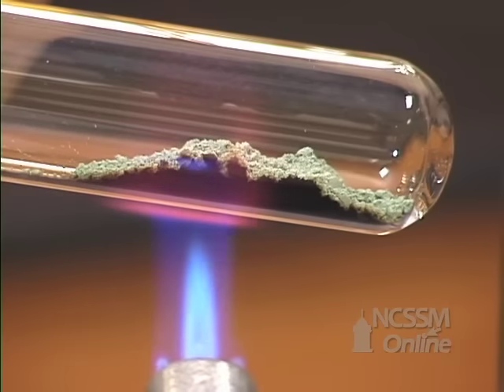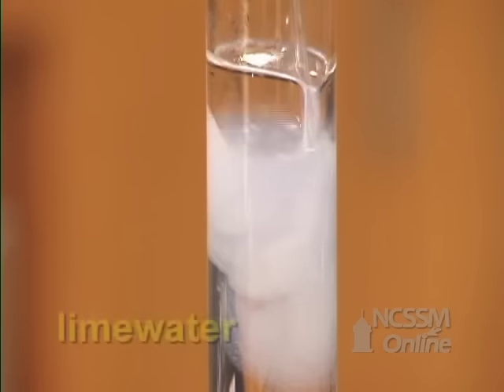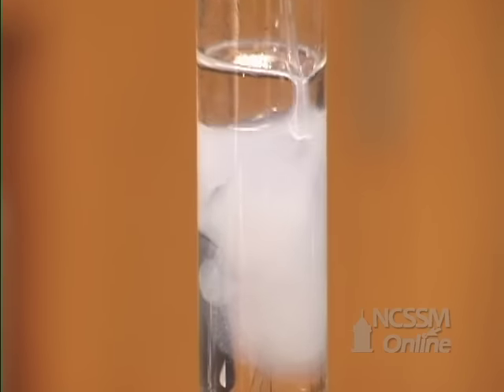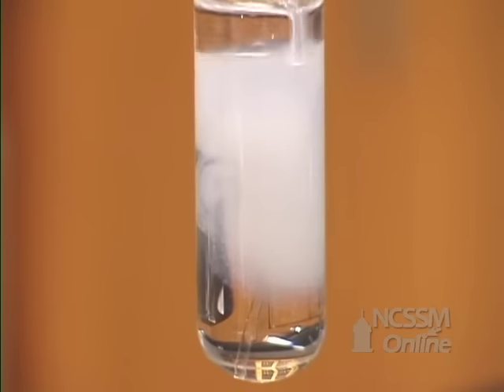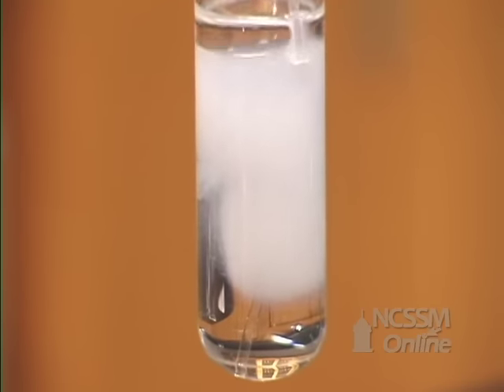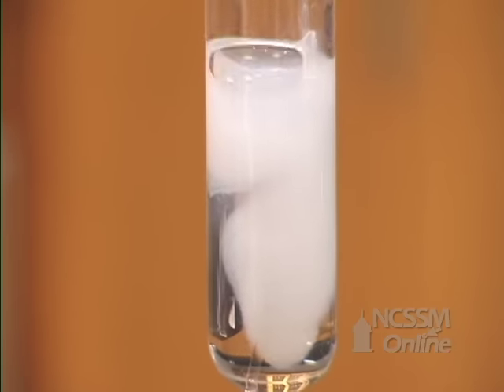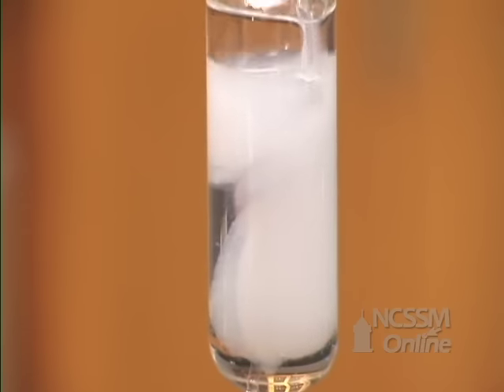The carbon dioxide that is released is bubbled through limewater. The limewater is a solution of calcium hydroxide. The carbonic acid and the calcium hydroxide react to produce calcium carbonate, which is insoluble. The limewater turns cloudy because the carbon dioxide, as it bubbles through the water, produces carbonic acid.